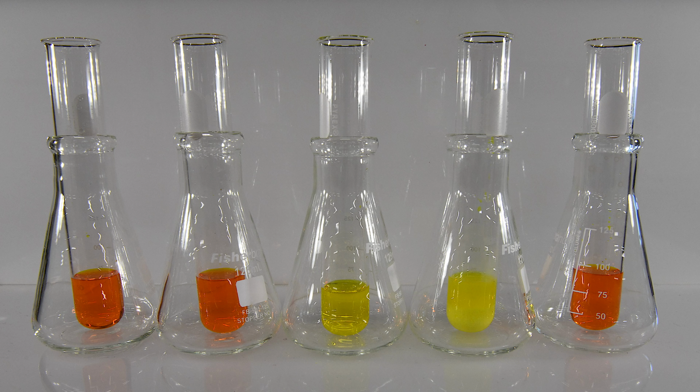And finally, here is all of the reactions that took place with the potassium chromate. The magnesium, calcium, and hydrochloric acid all turned a lovely orange color. Strontium seems to have remained unchanged, and barium formed a precipitate. So this is all the information you should need to complete the lab. You can go ahead and answer all the questions and then submit your experiment.